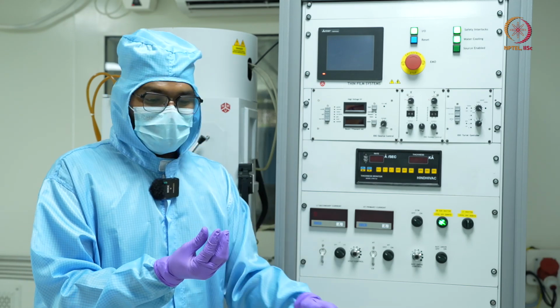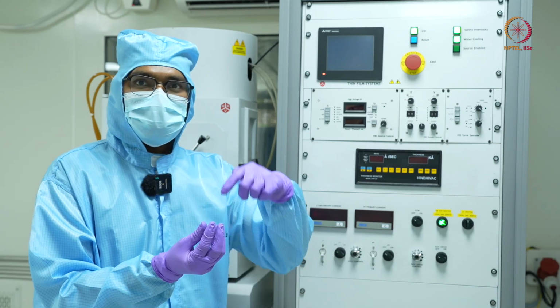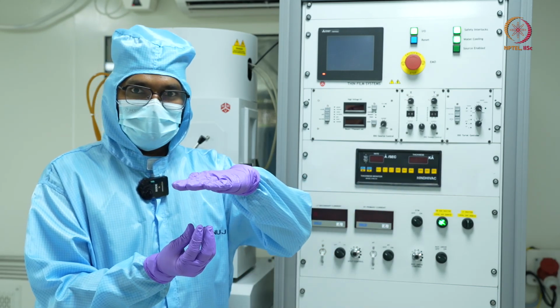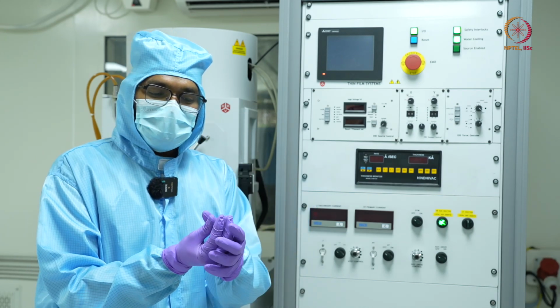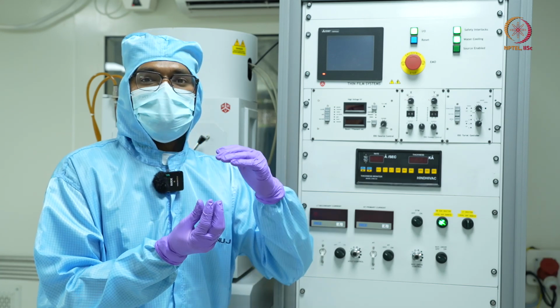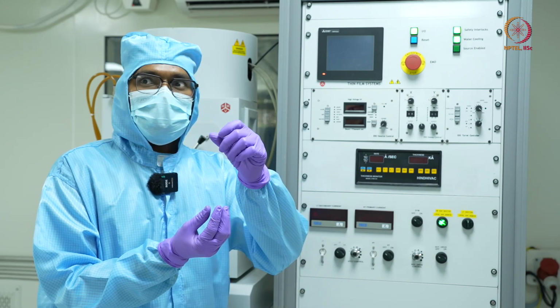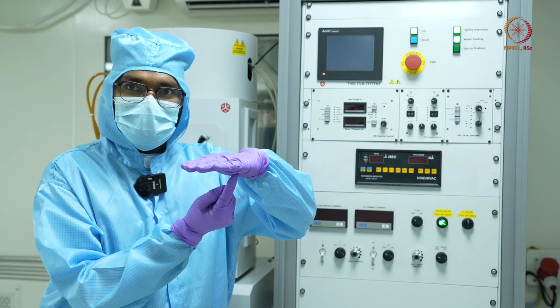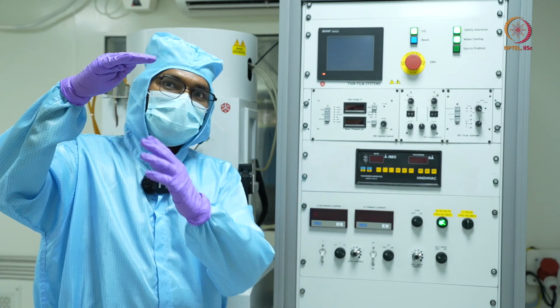So what I'll do meanwhile, when my material is getting heated slowly, is have a shutter or a cover on top of this crucible. Unless and until my crucible or my material is sufficiently heated that I know exactly the deposition is going to start, I'll keep this shutter on. So whatever irregular deposition happens will only happen on the bottom side of my shutter, and it will not affect my sample or the substrate.